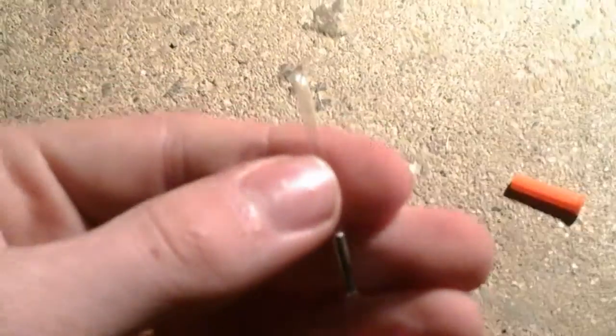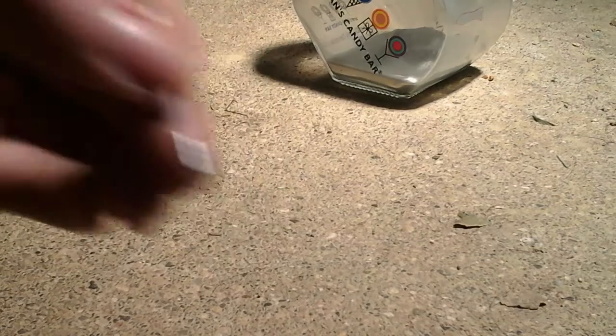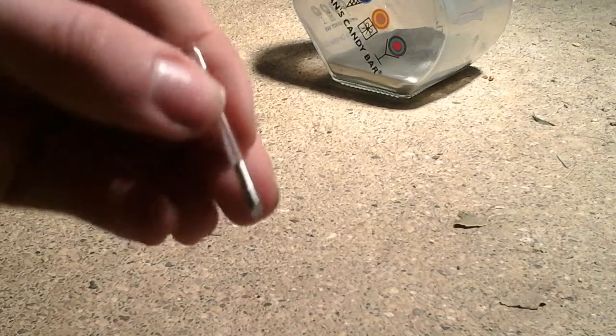Because I didn't have my tools around, I had to use the tip of the syringe to pull a piece of the glass away, and I sealed the ampule successfully. So now I have a sealed sample of mercury — look at it. It doesn't really flow easily; I might have to get a bigger tube and try again. But you can definitely see it in there. Sweet.